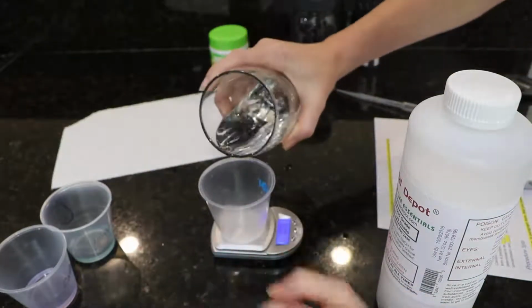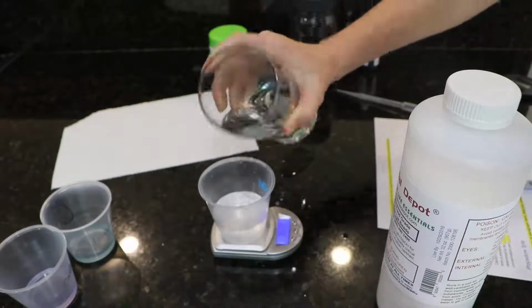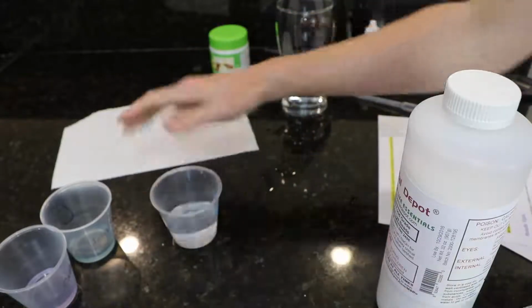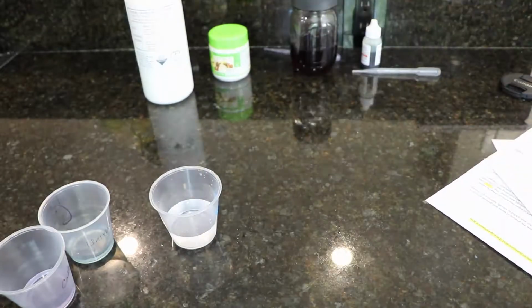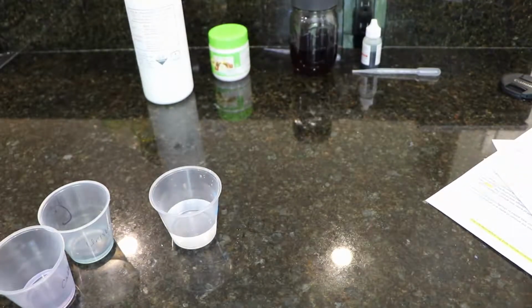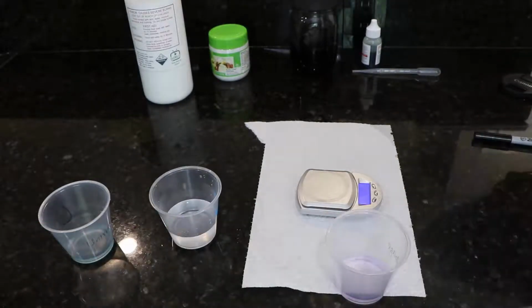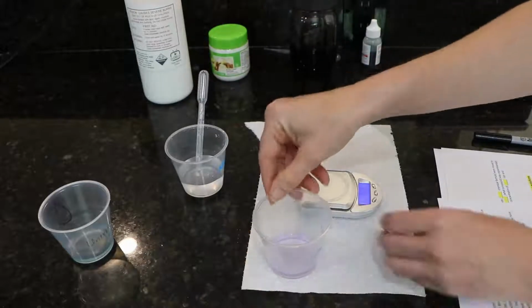See, sodium hydroxide is hygroscopic and it absorbs water from the air. So then I need the mass of the water that's going in here, and you want somewhere between 40 and 50 milliliters, which means 40 and 50 grams of water. And I'm going to use a dedicated pipette to stir that. And as you can see, I'm trying to keep my lab space clean because I don't want any cross-contamination. I also don't want to make an enormous mess.